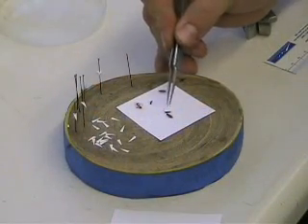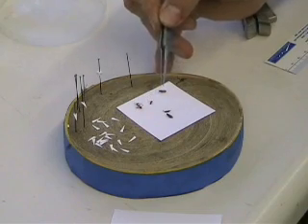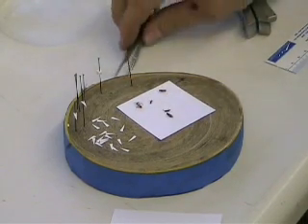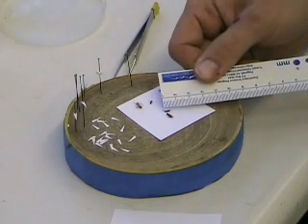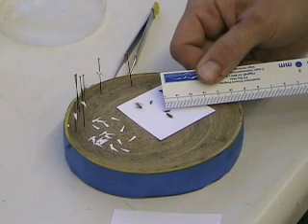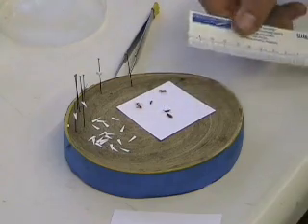These are some examples of specimens that you'd want to put on points. We've got ants, small bees, sawflies. Any insect that is less than 7 millimeters in length and their thorax is about 2 to 3 millimeters in width — those are specimens that you'd want to point.